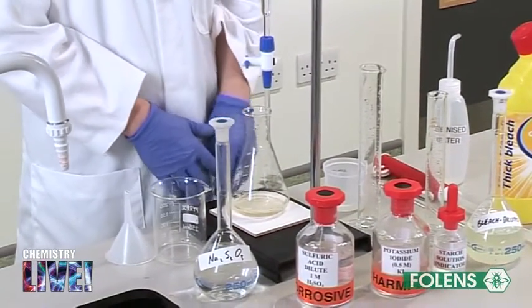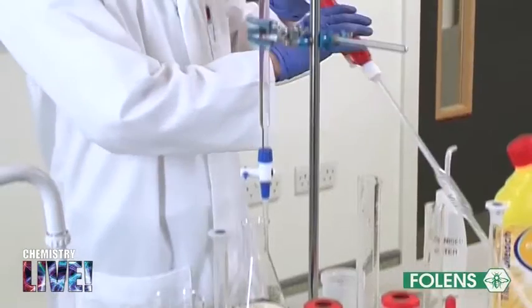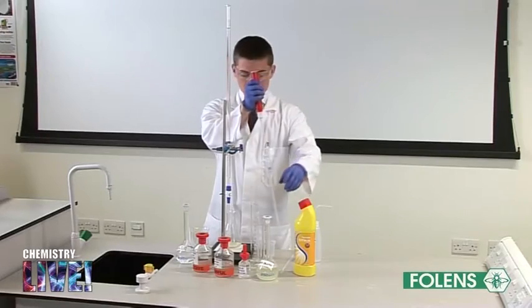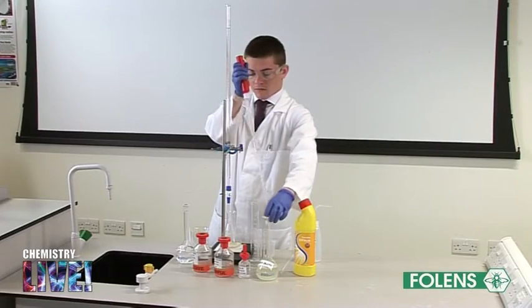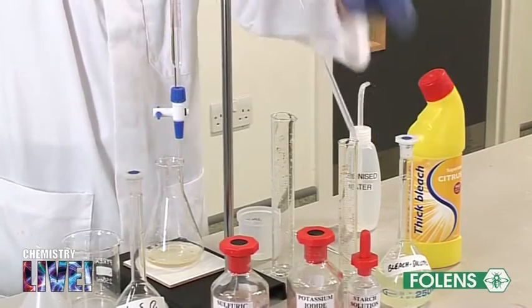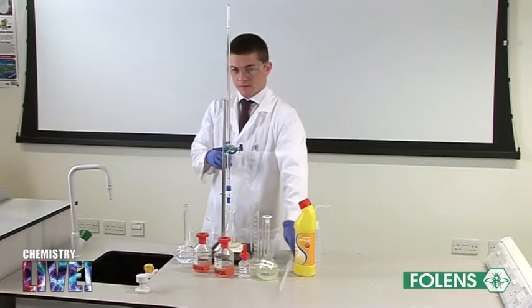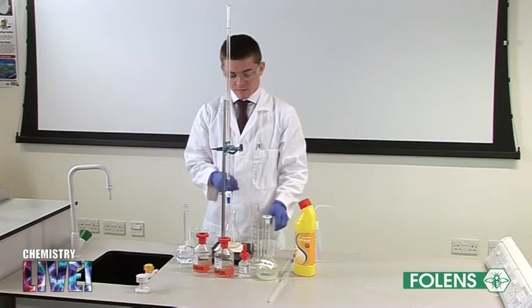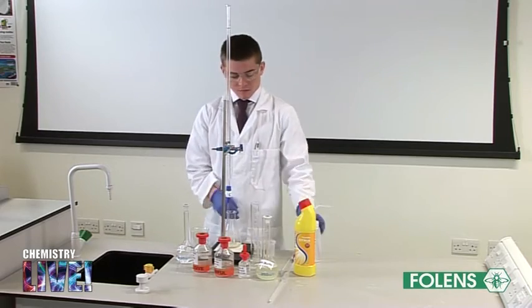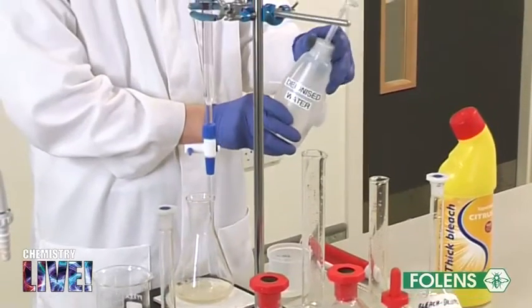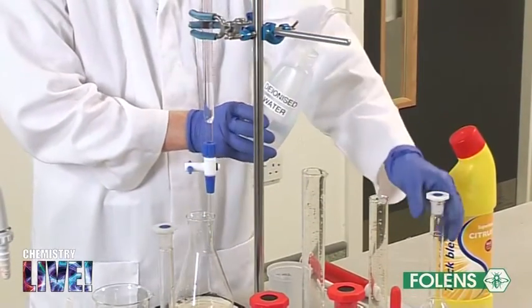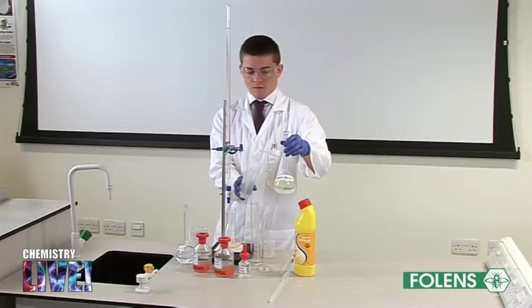Using a pipette filler, 25 cm³ of the concentrated household bleach was pipetted into a clean 250 cm³ volumetric flask. As household bleach is usually fairly concentrated, it must be diluted before it is used in this experiment. Otherwise a large amount of reagents would be used in the titration.